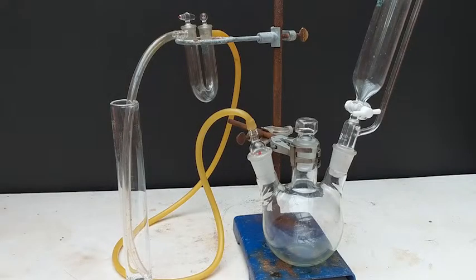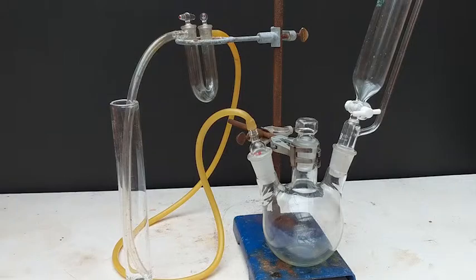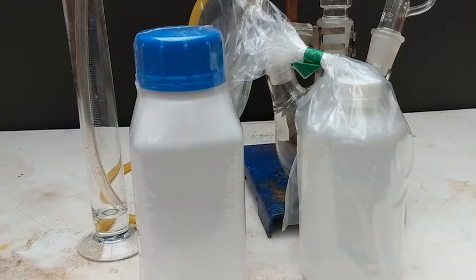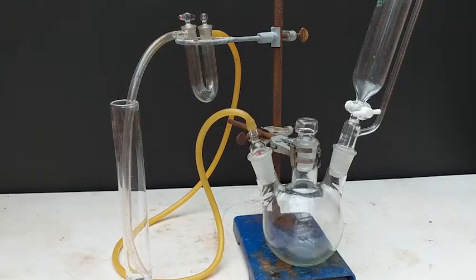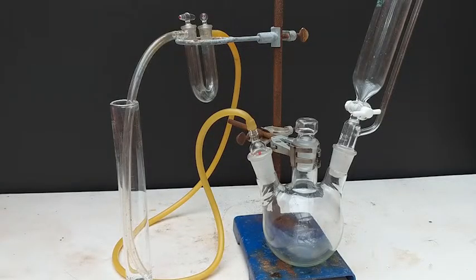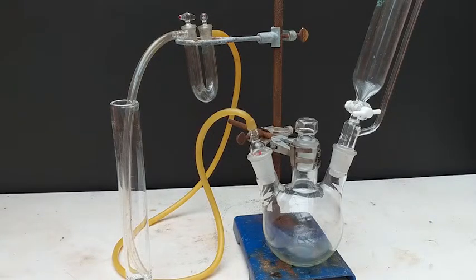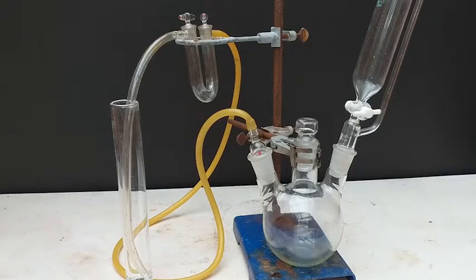Okay, we are back with a new apparatus and some new chemicals. Let's give this another go. We purchased some calcium oxide and some more glacial acetic acid. The calcium oxide should be able to dry the ammonia gas as it passes through the tubes. Other drying agents like calcium chloride would not work, as most drying agents react with ammonia gas.